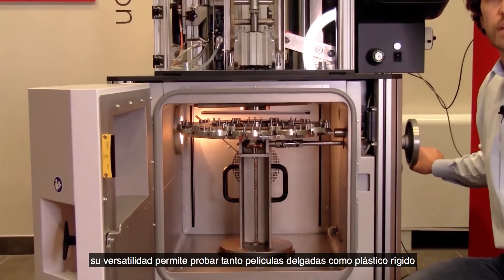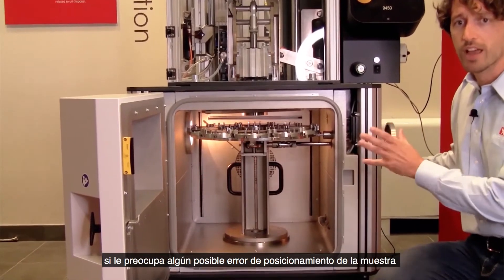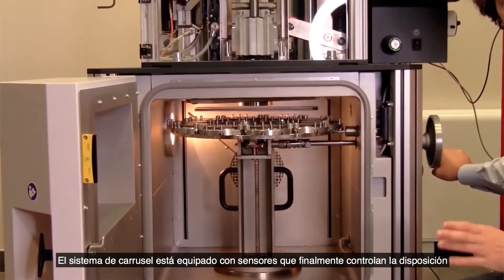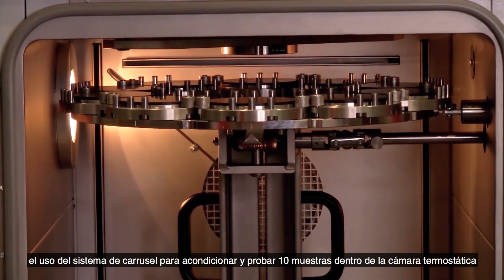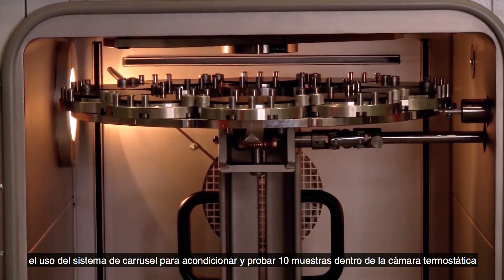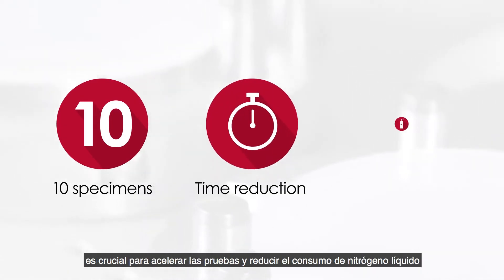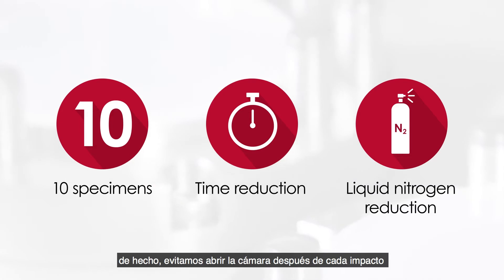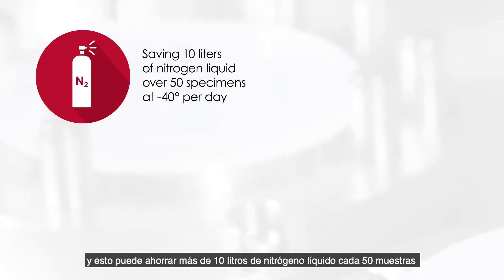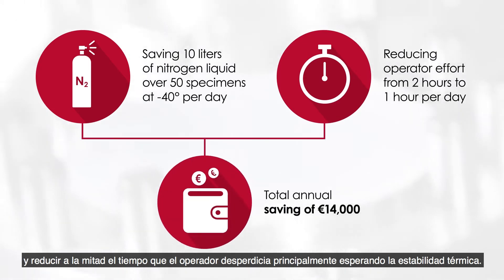Its versatility allows testing of both thin films and rigid plastic. If you are concerned about any possible positioning error of specimens, the carousel system is equipped with sensors that finely control the disc positioning. Using the carousel system to condition and test 10 specimens inside the thermostatic chamber is crucial to speed up testing as well as reducing the liquid nitrogen consumption. In fact, we avoid opening the chamber after each impact, which can save more than 10 liters of liquid nitrogen every 50 specimens and reduce by half the operator's time — mostly wasted waiting for thermal stability.